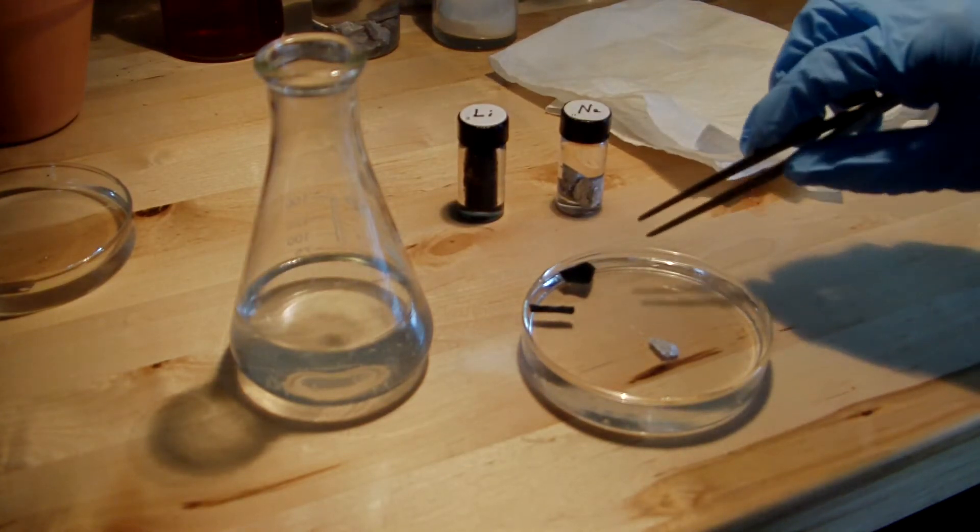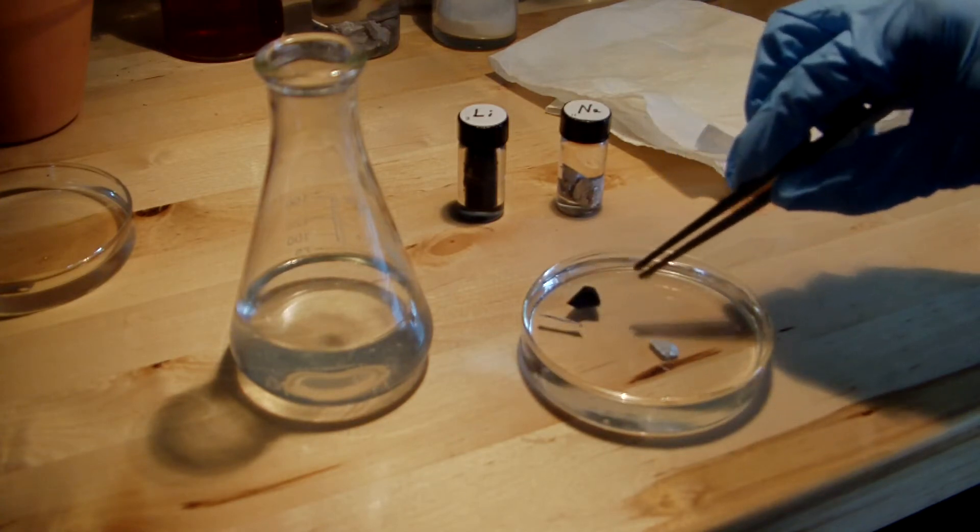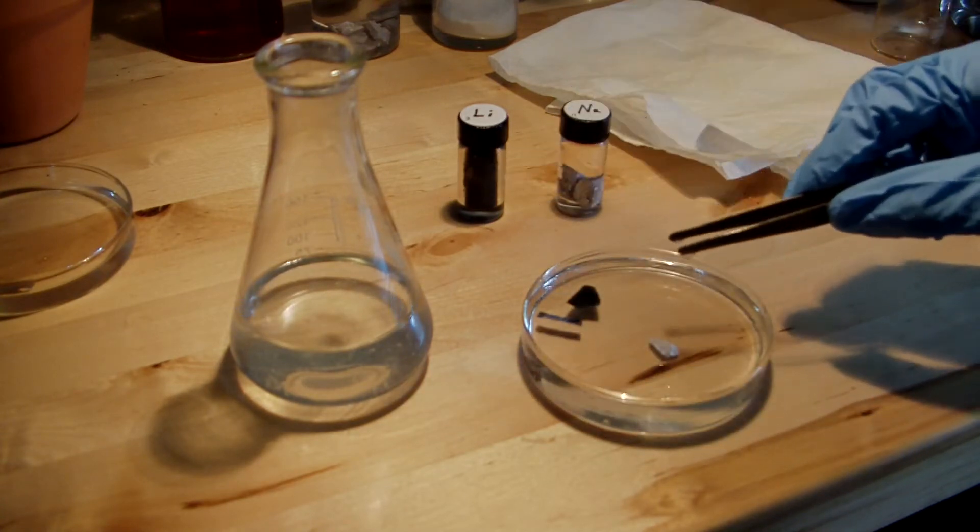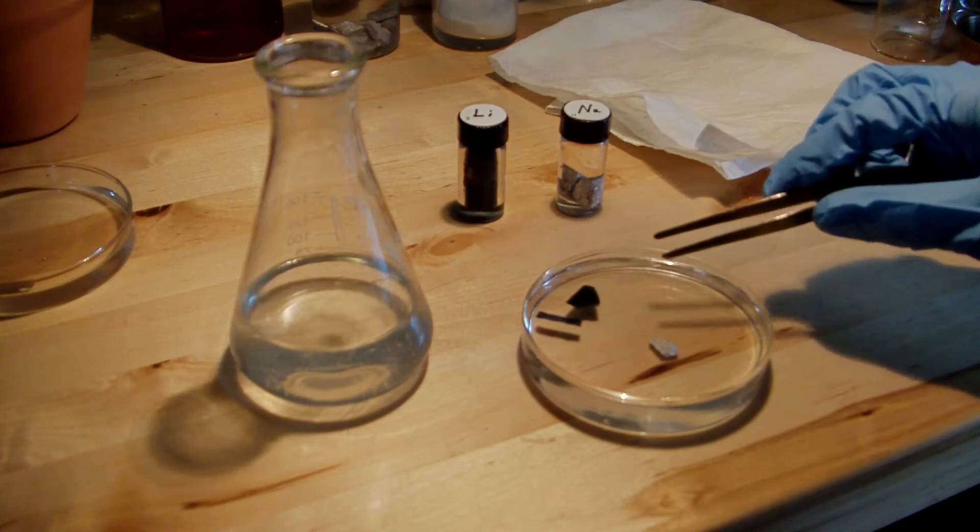I have a couple of pieces here floating around in some oil and what I'm going to do is drop them in a flask of water and we'll compare the reactions between them.